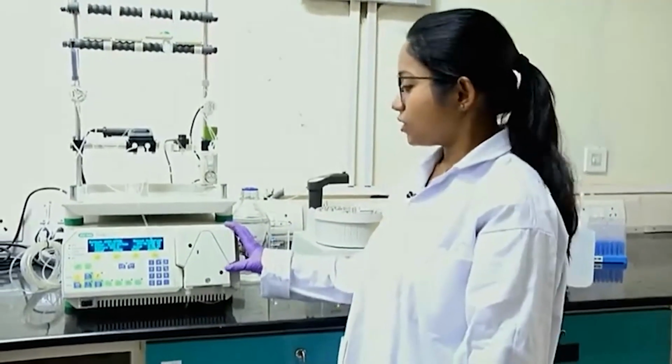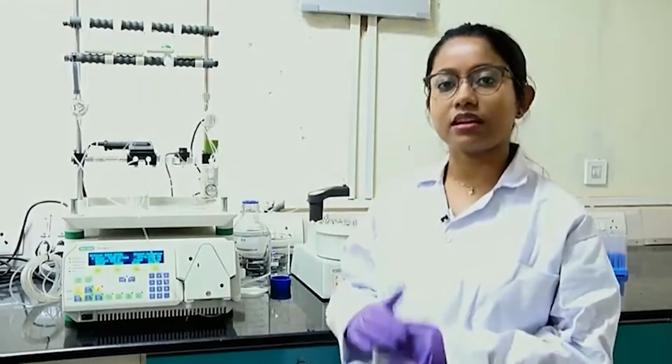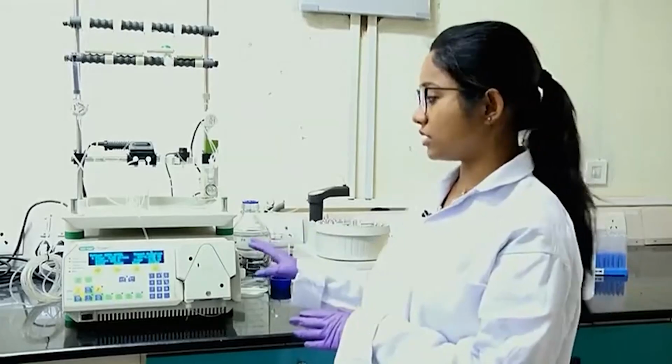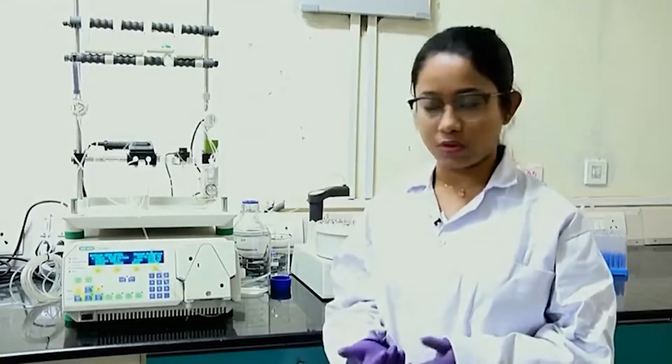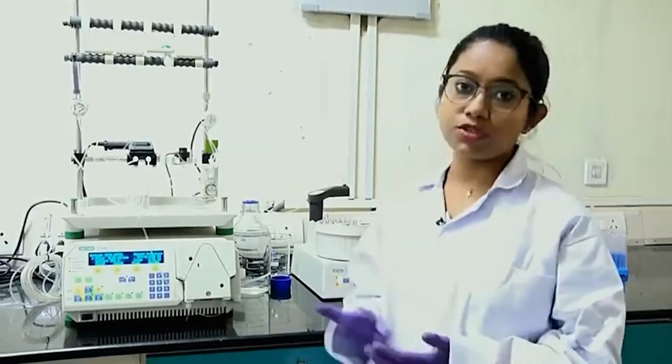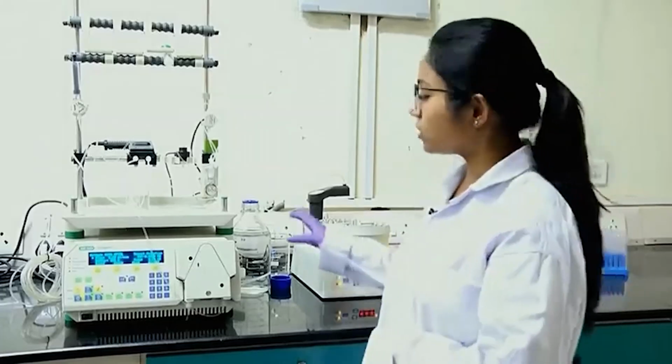So, before we begin with our purification protocol, first we need to prep the instrument, the FPLC system. When other people are done using the FPLC system, they store all the tubes in 20% ethanol. The tubes are stored in 20% ethanol because it inhibits any kind of contamination or microbial growth. So, first we need to replace this 20% ethanol in all the tubes with deionized water. So, first I will begin with running the water.